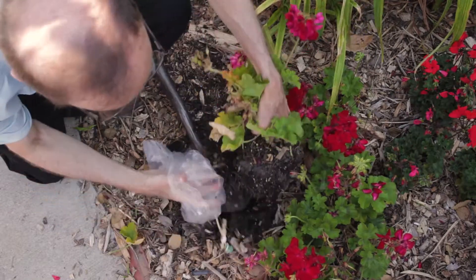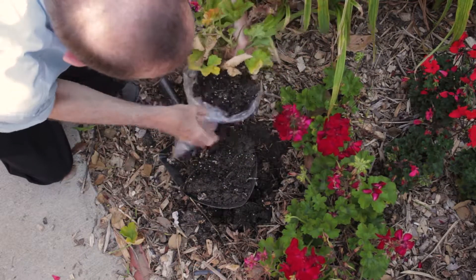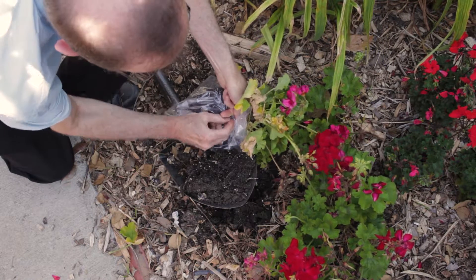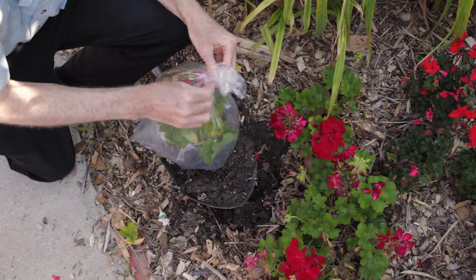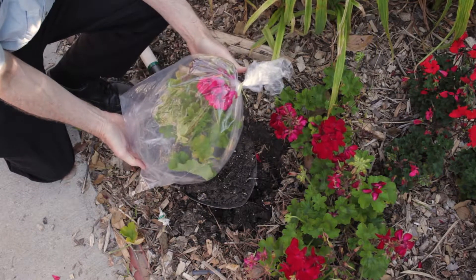Always dig — do not pull the plant from the soil. Wrap the roots and the soil around them in a plastic bag and fasten it loosely about the base of the plant so that the soil doesn't get on the foliage. Then place the entire plant in a second plastic bag. Don't add any moisture to the bag, and avoid leaving the sample in the sun after taking it.